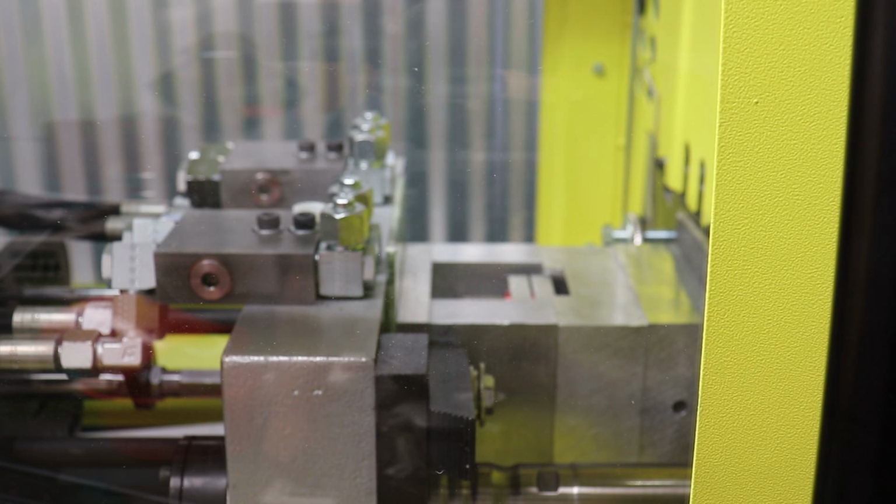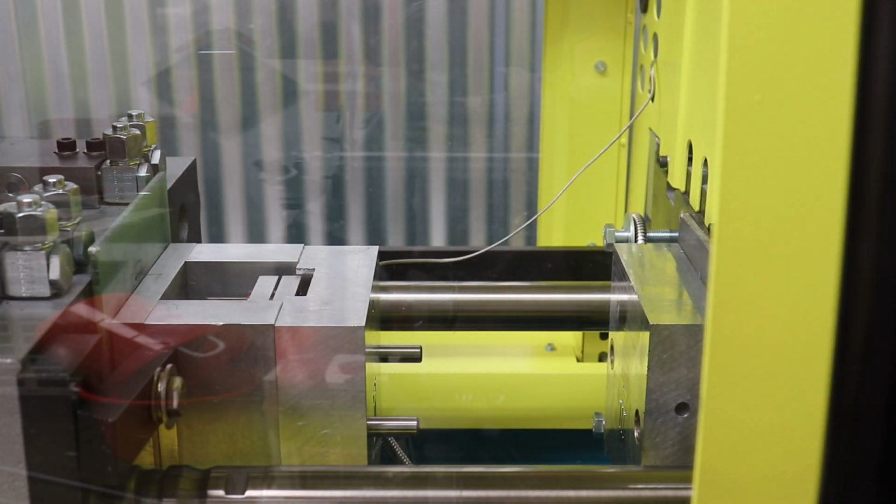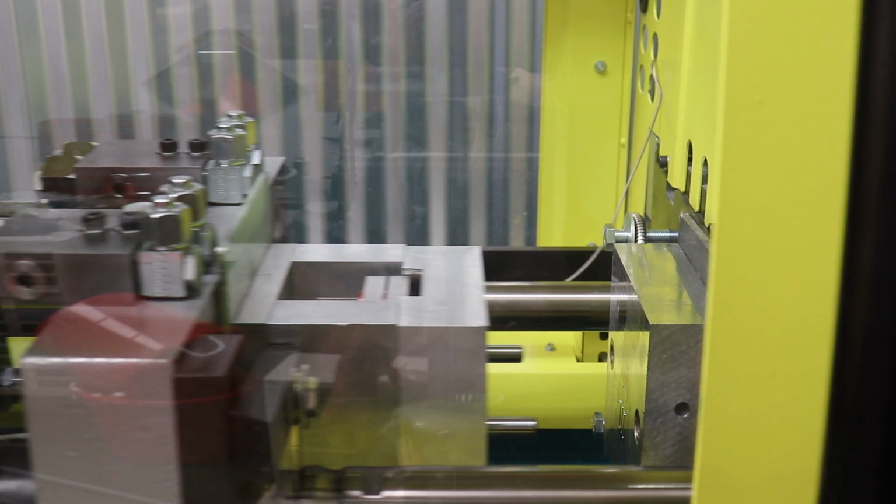Okay, now we have 1.3 millimeters of plastic remaining, which is a good sign. That means we filled the mold and we were compressing the plastic, but we didn't run out of plastic to basically push into the mold. There we go. So our sprue puller worked and our part ejected. That's a really good sign. So it may be amazing, but for the second part, we may be able to go to fully automatic mode. So let me hit the fully automatic mode and start.